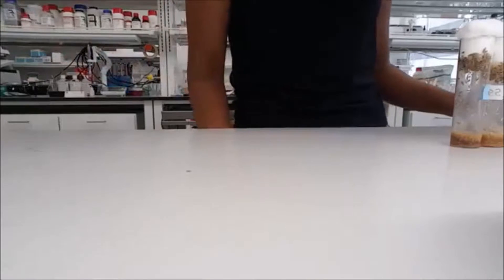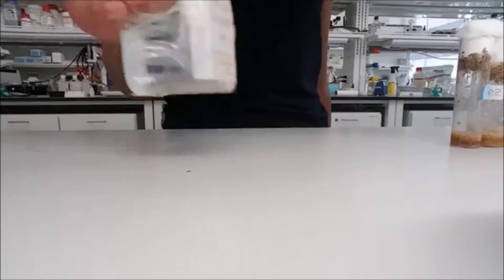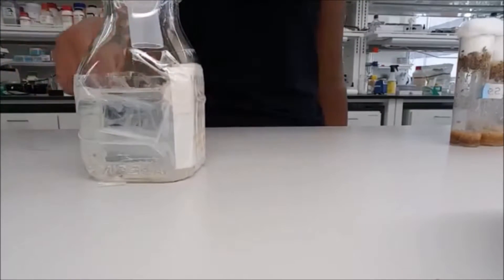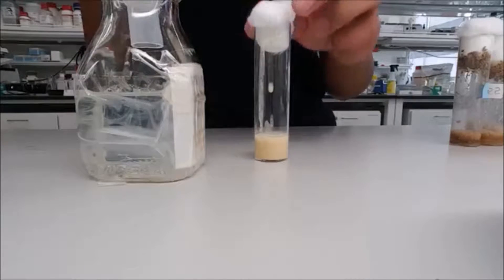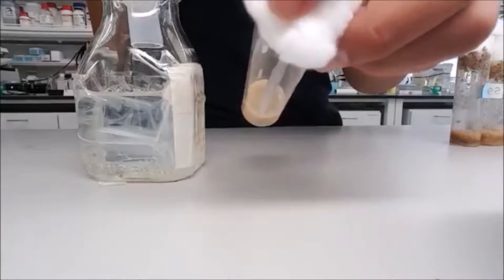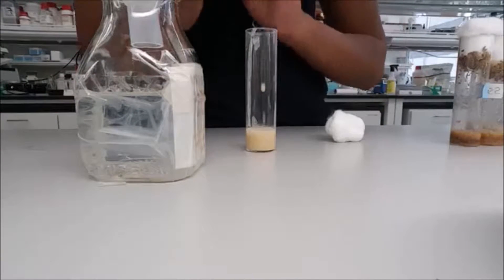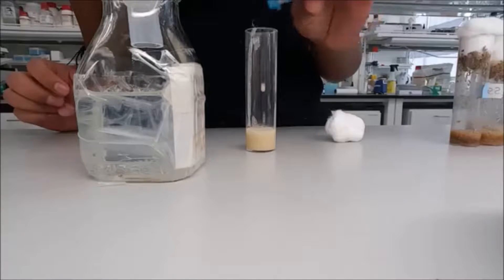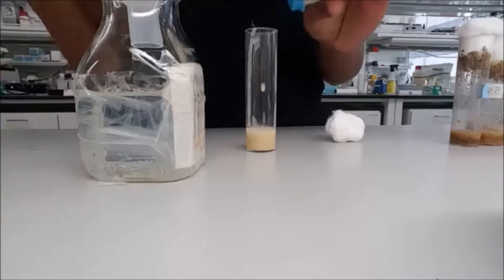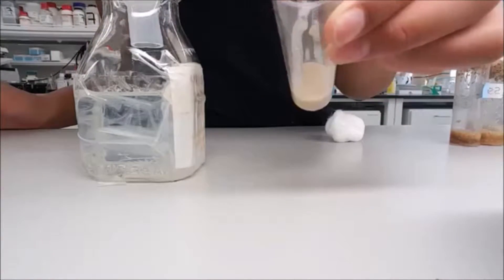To start flipping, you're going to want to first get a fly morgue, which is water and soap. Next, make sure the food has yeast — this food does not have any yeast, so we're going to yeast it. But not too much, because too much yeast can actually end up killing the flies just as having no yeast can. This is a good amount of yeast, as you can see.